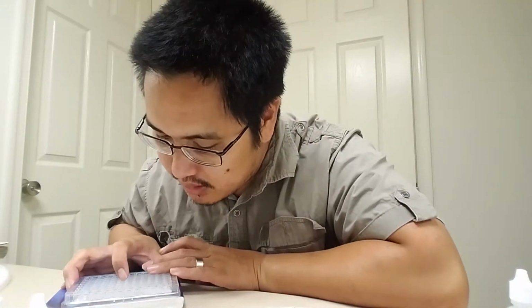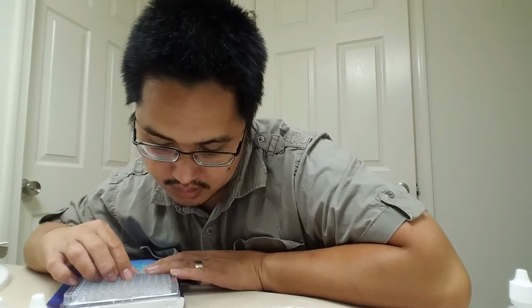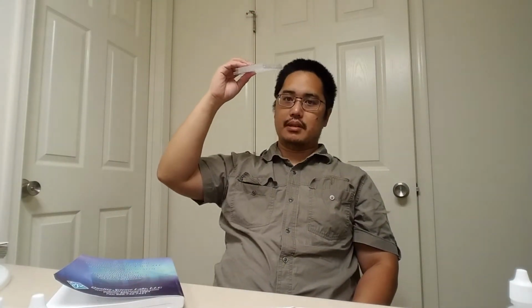Now, one thing you can do is put this up against a black paper or something dark, so you can kind of see, and I can actually see some reactions taking place. Another thing you can do is, okay, wait 1 second. Okay, another thing you can do is hold this up to the light, and maybe you might be able to see it a little bit better that way. And so basically now you can observe the reactions that took place in this case.